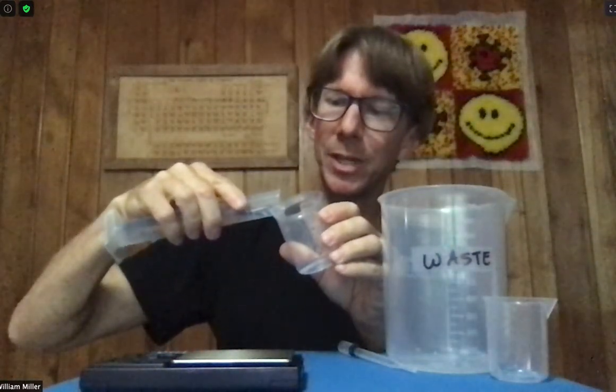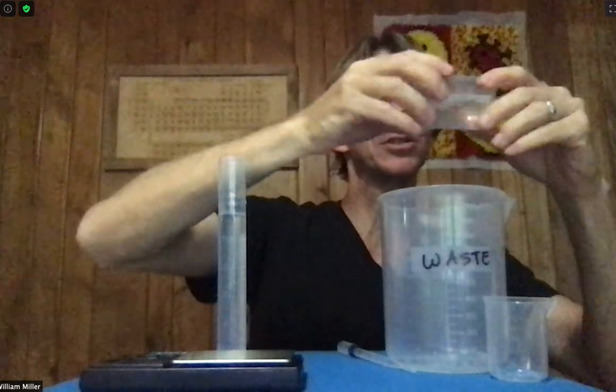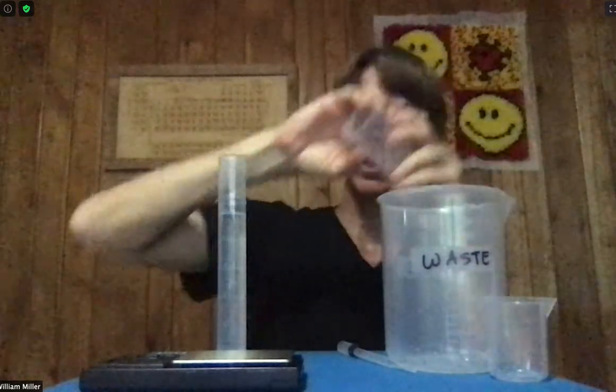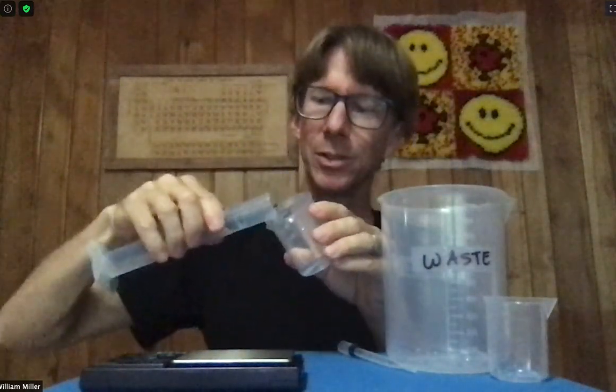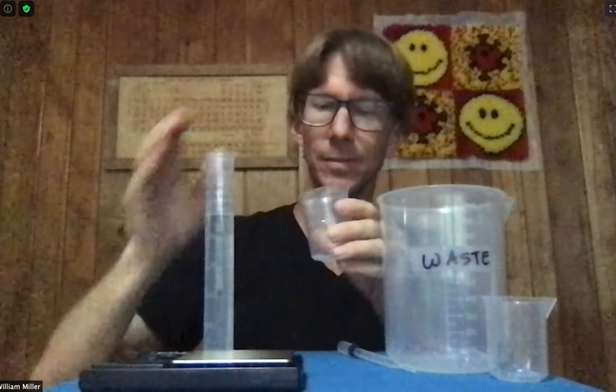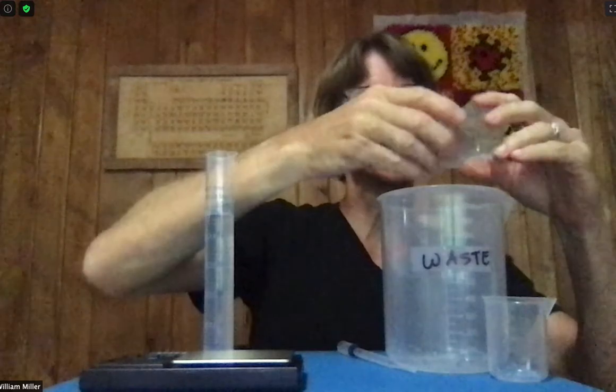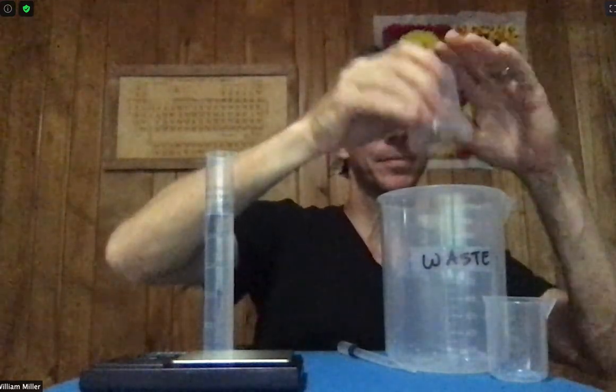Conditioning — you do it once, you do it twice, you do it a third time. You do want to use a relatively small amount because we don't want to waste our nice known concentration solution. After coating the entire inside three times, whatever is in here is the solution that I need, and I can transfer the rest of the solution in and know that I'm not diluting it.